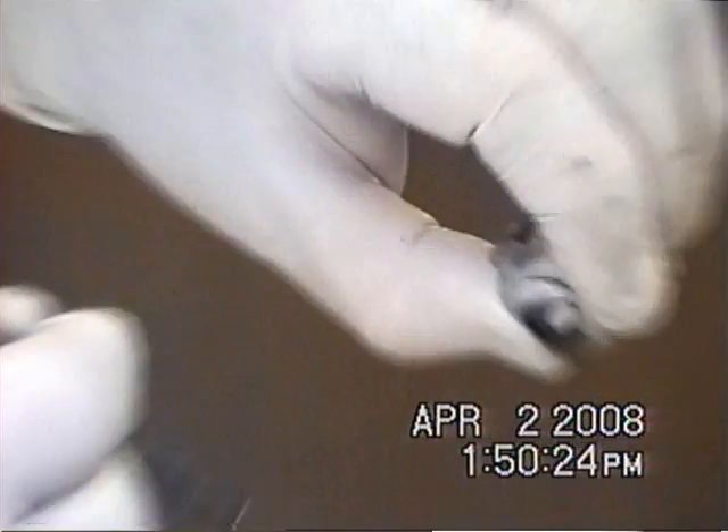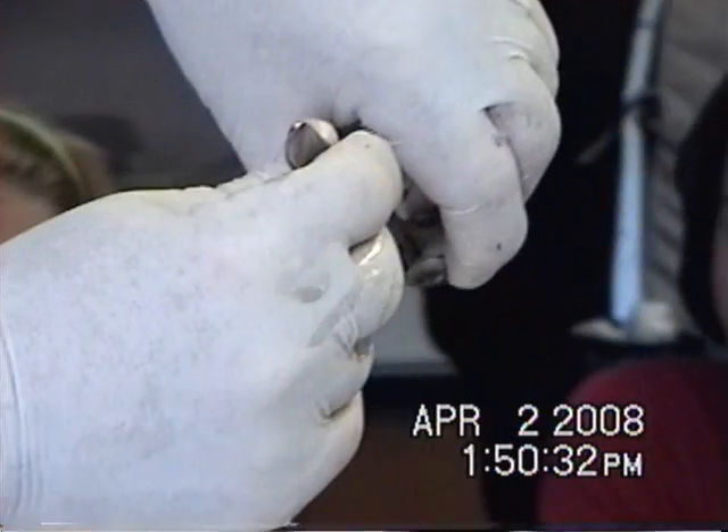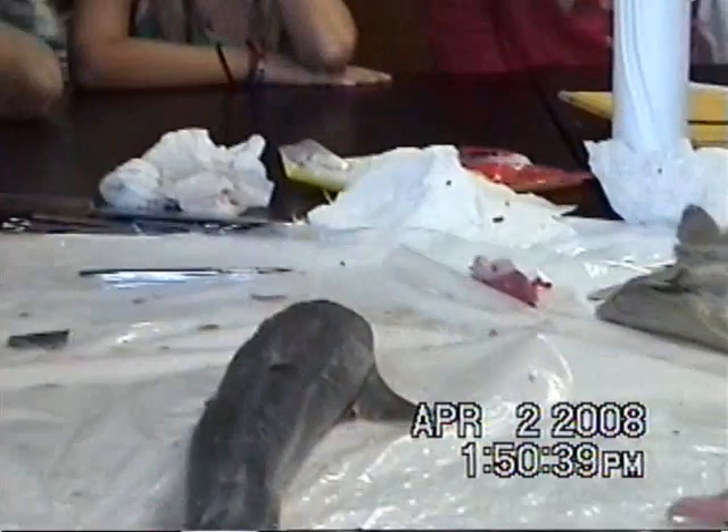If you want me to gross you out, this is my opportunity. There is some fluid in here — watch this. I'll just put a small hole and then I will squeeze the bejeezus out of it. It's like a lemon. It's just like a tomato.